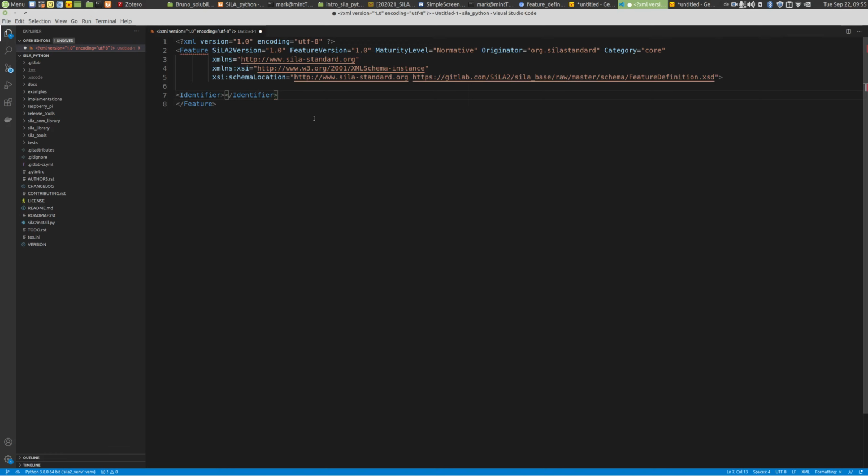The first thing you should do is specify an identifier. And in our case, we would like to have a shaking controller feature. So let's call it ShakingControllerFeature.